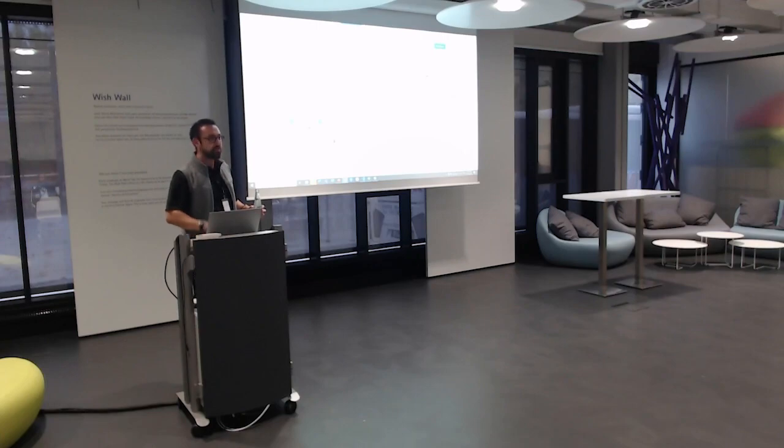And here you can add many different objects. So for the basic objects, a notebook in which you're going to put experiments, but it could be many other things. It could be test requests that can be sent out to somebody else for somebody else to conduct. Parallel chemistry experiments, as in combinatorial chemistry, requesting material, you name it. It's tailored for you to enter your research in a way that's as easy as possible.